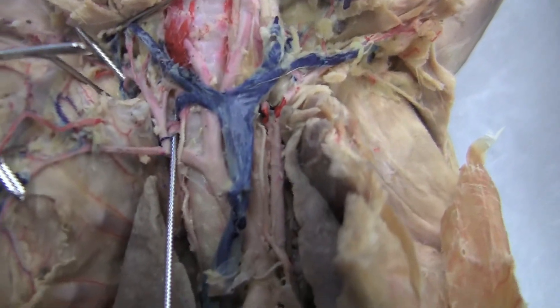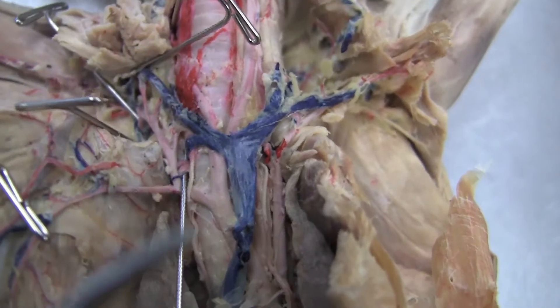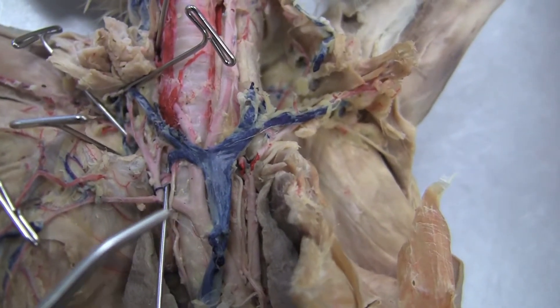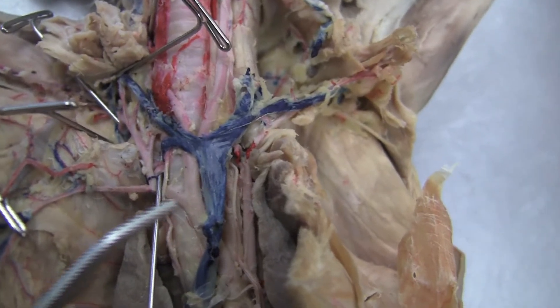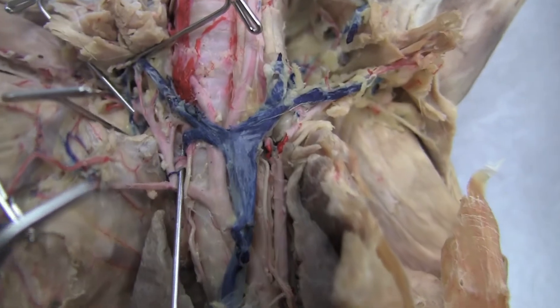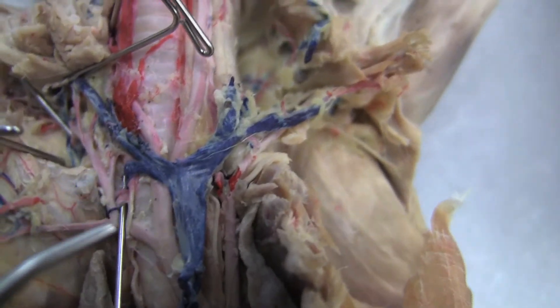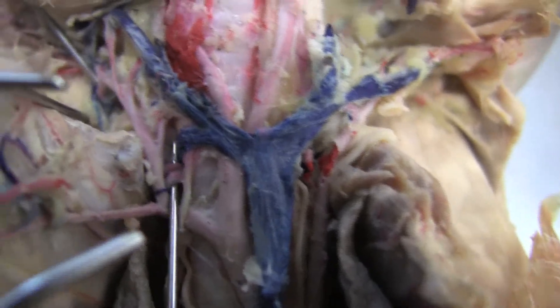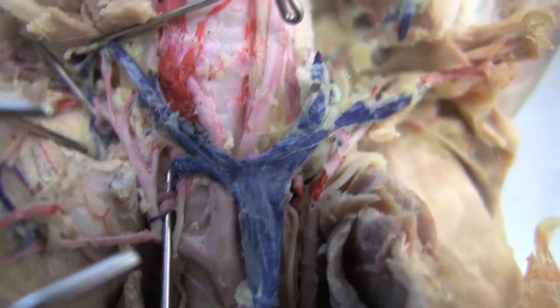Coming back down, it will turn into the subclavian. The subclavian will branch off of the brachiocephalic. Off of that, the internal mammary will come out towards the chest, and right past that — it will be hard to see — but you can see that there are two arteries coming off of that brachiocephalic.